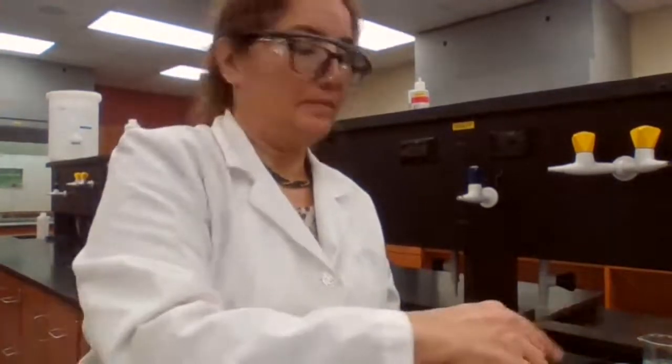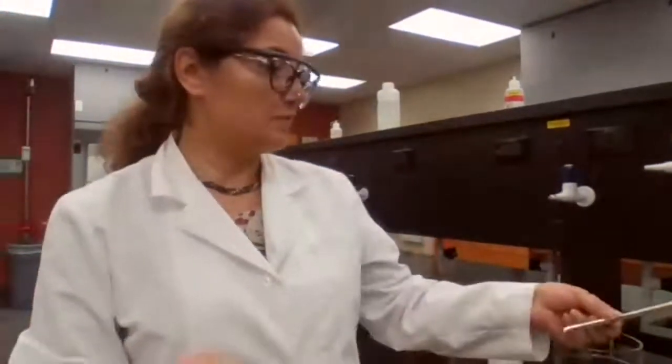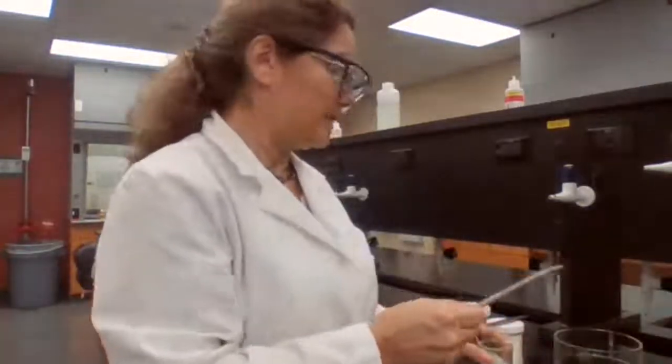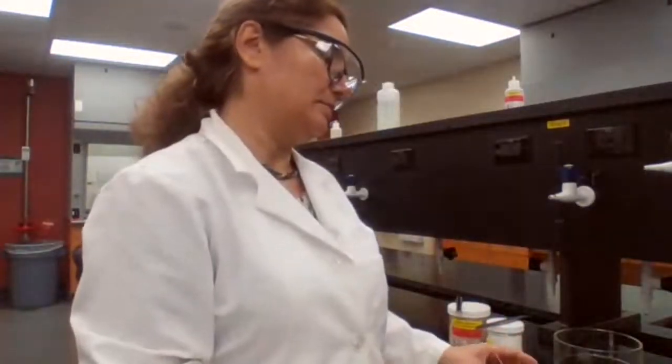For the beaker with the neutral compound, 50.086. The second number was the mass for the beaker with the ether sample.